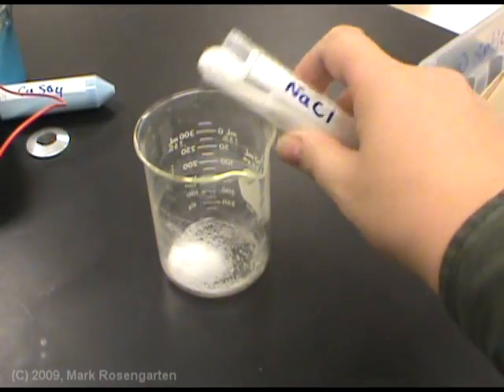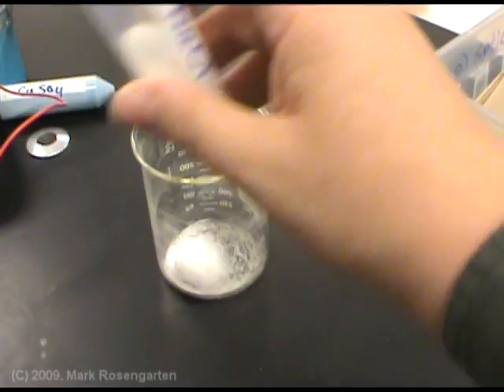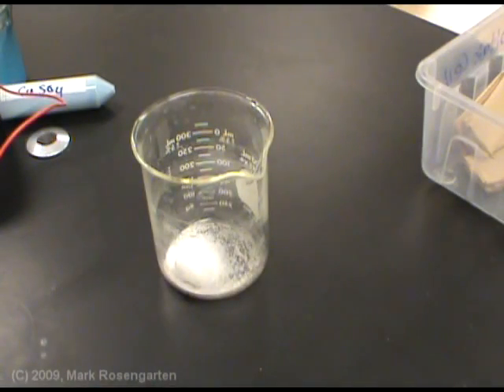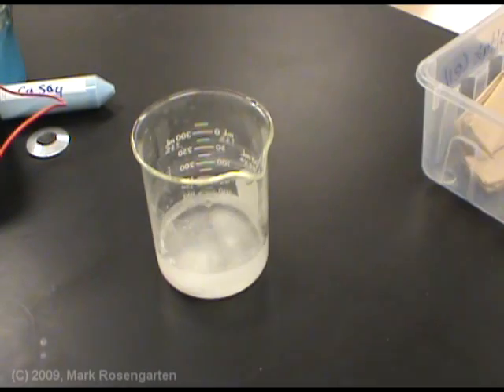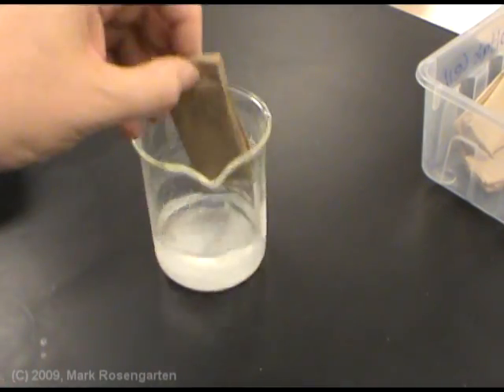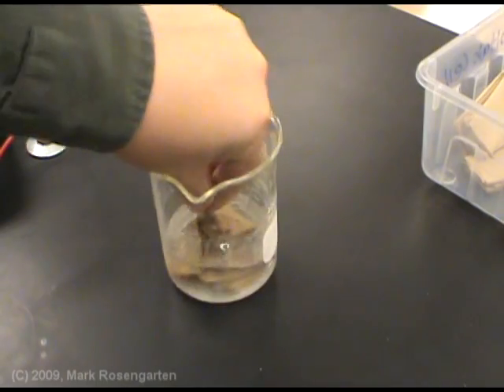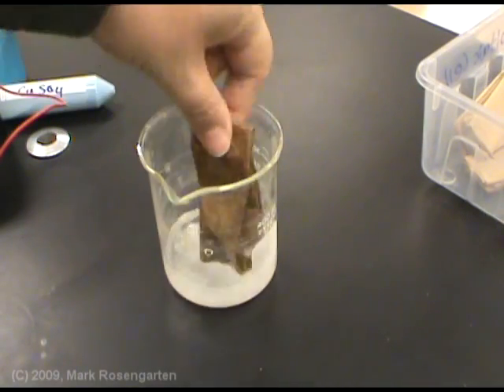So, we take some salt, we add distilled water to it to make a solution, and then we take our semi-permeable membrane, place it in here to soak it.